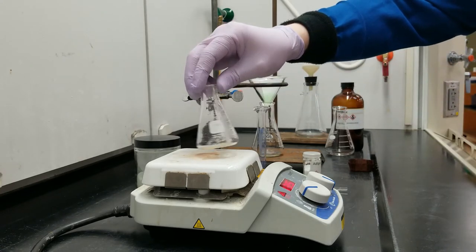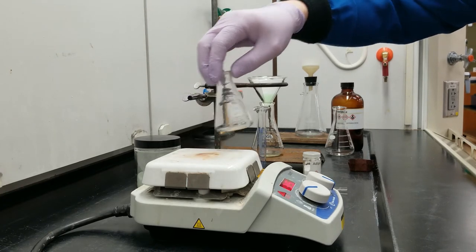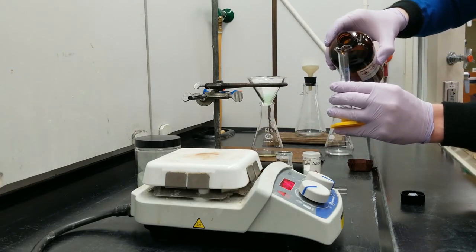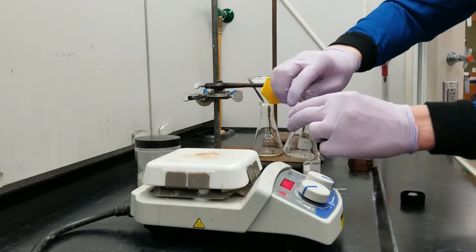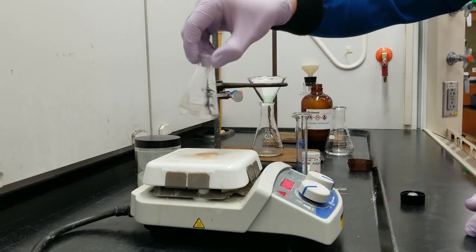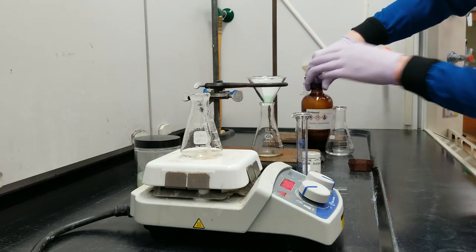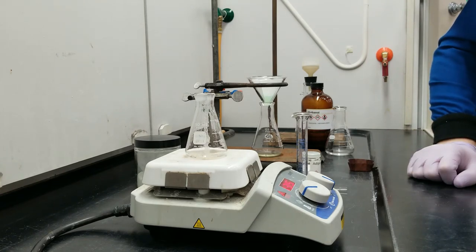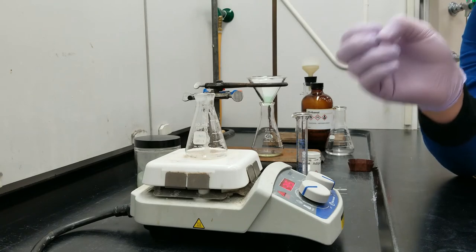It's almost entirely dripped through over in my funnel. I'm going to take this reheated mixture over here and I'm going to go ahead and pour in the rest. Now I'm going to do one last step. You can see there's a lot of solids that are still stuck up on the walls of this glass. Almost all of that, I promise you, is sand and mica. But there might be a little bit of adipic acid still in there. So I'm going to take another five mils of methanol and I'm going to add it to this and give it a swirl and a heat. And in a very similar procedure to what I've been doing so far, capture any more adipic acid which is trapped in that sand.